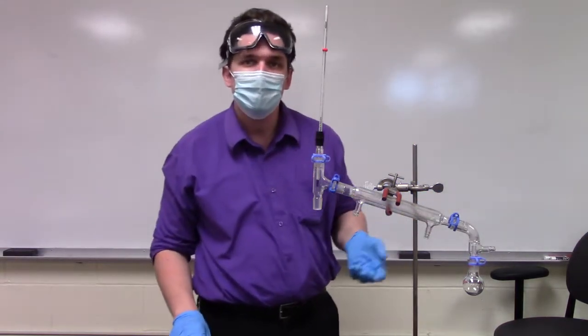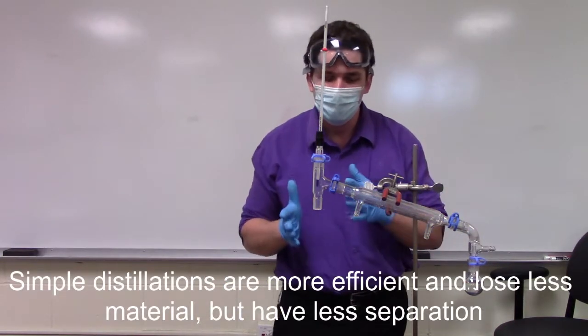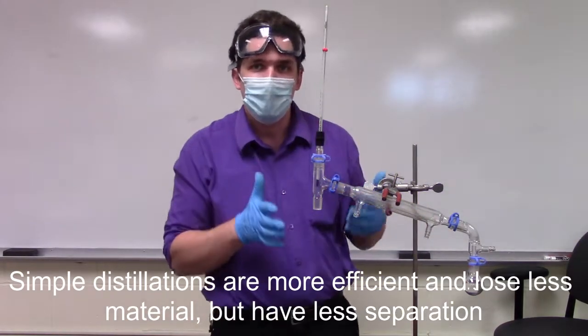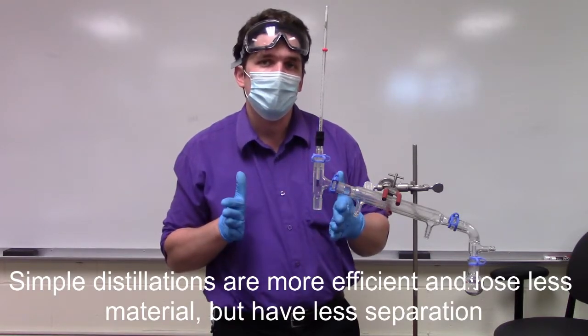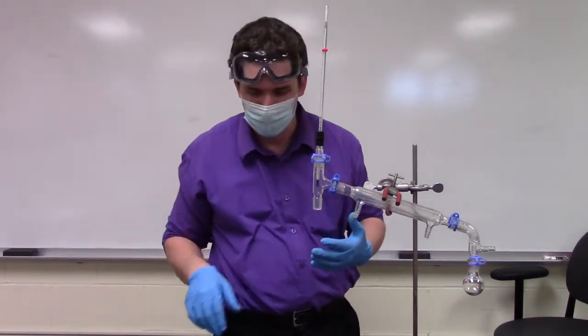Now, why would you use one over the other? Well, simple is more efficient, meaning that typically what we get is a very little loss of fluid to the distillation apparatus, and it goes pretty quick. The drawback is we don't get very good separation. So if we have two things with similar volatilities, we're going to end up not really getting good separation.